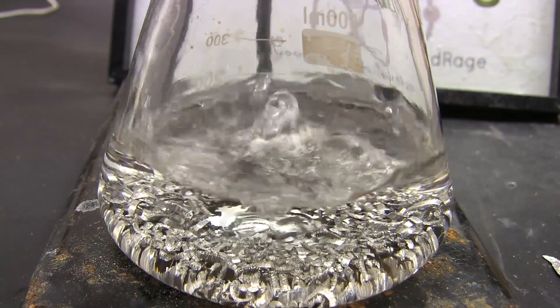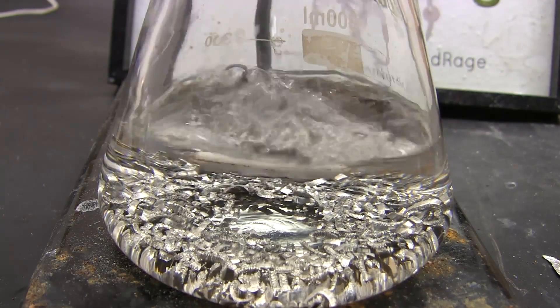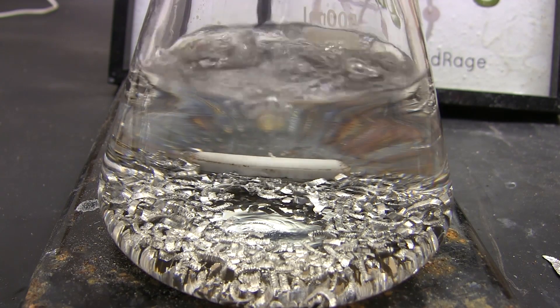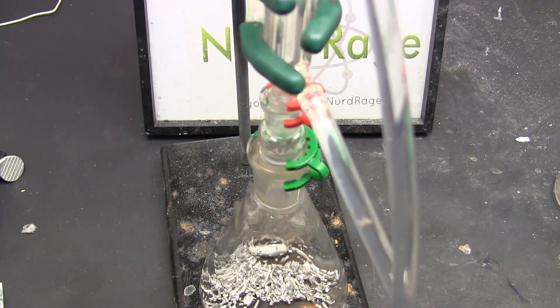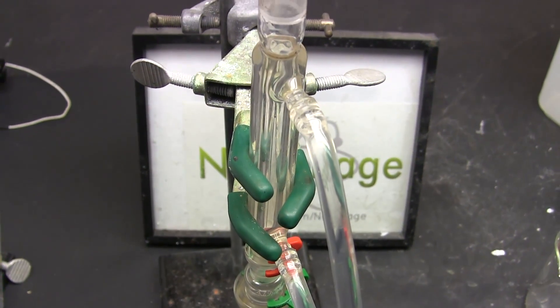Solvents should be fractionally distilled to remove as much water as possible. Chemical drying is effective but expensive if you have excessive amounts of water and need to add more chemicals to compensate — garbage in, garbage out. Now on top of the flask we set up a condenser as a reflux column. We don't want any of our alcohol boiling away.